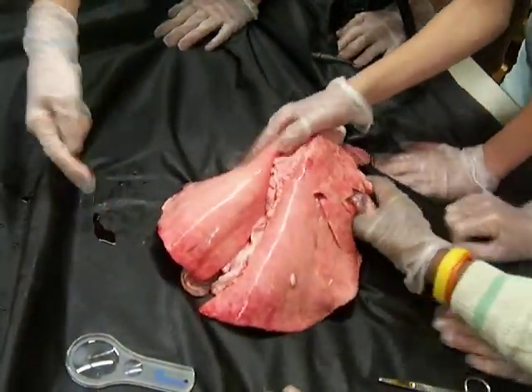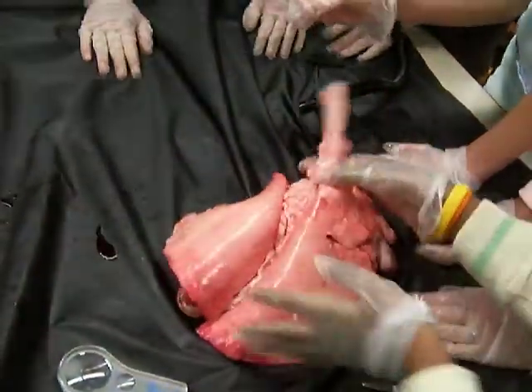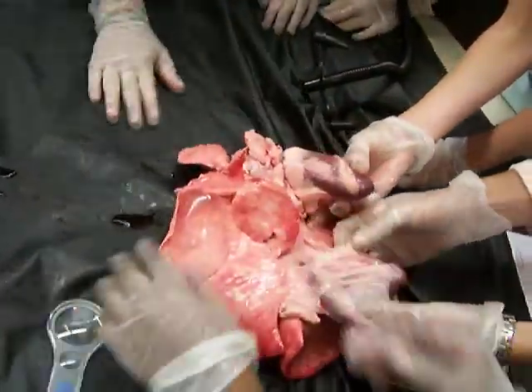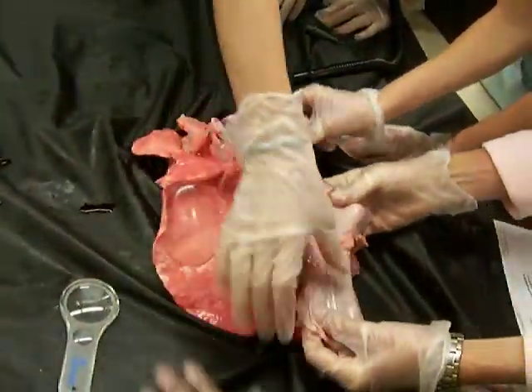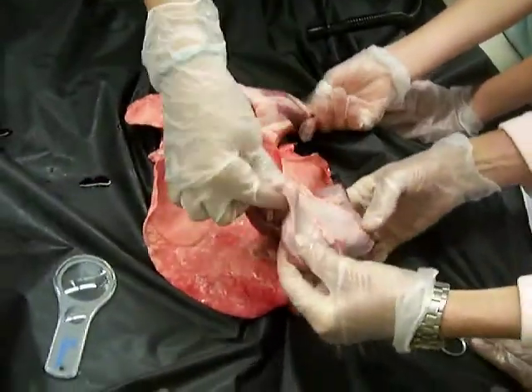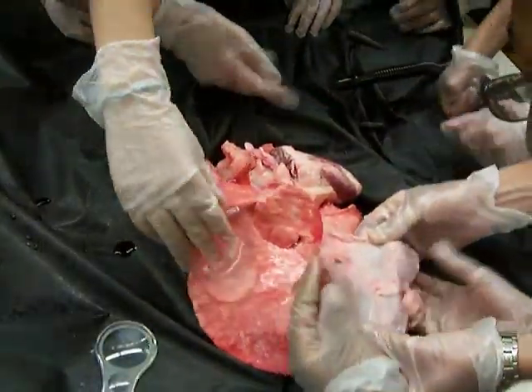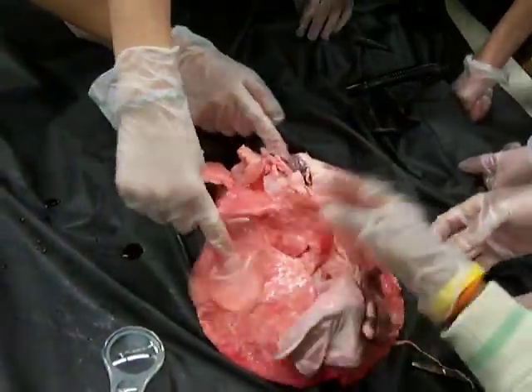What is this? Blood. Oh there's the diaphragm — that's the whole diaphragm, that's the diaphragm. The muscle that's underneath your lungs that inflates your lungs. That is very cool, that is very neat.